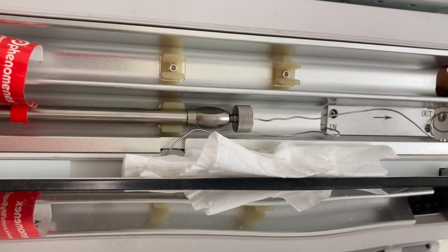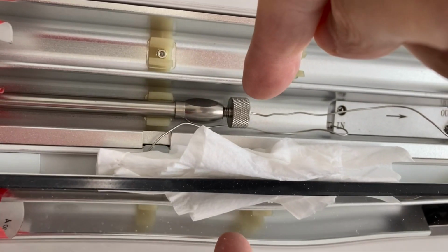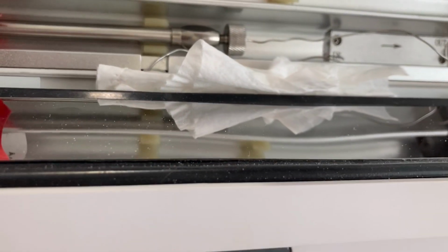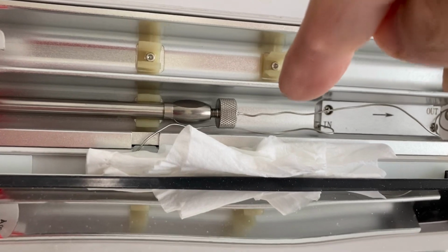This particular instrument has a problem with leaking the ferrule here, which is hard to source, the right size ferrule by the way, often leaks in this area as the pressure builds up. This is one of the biggest faults of this machine.